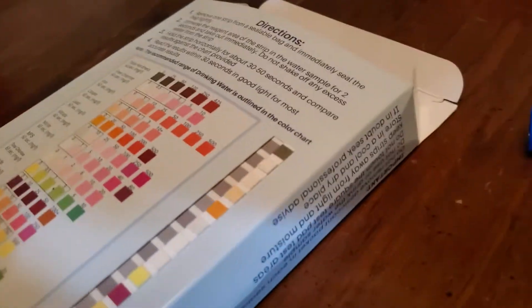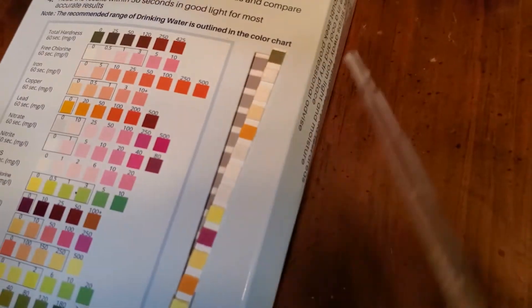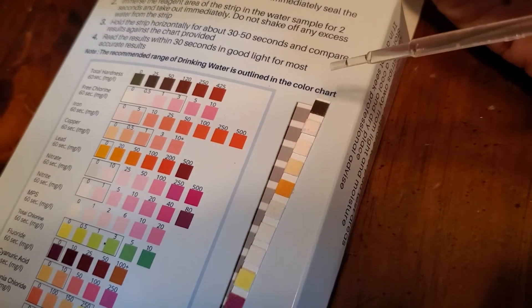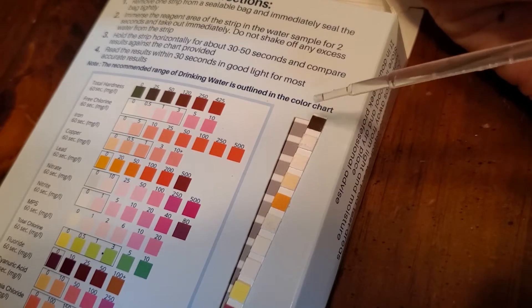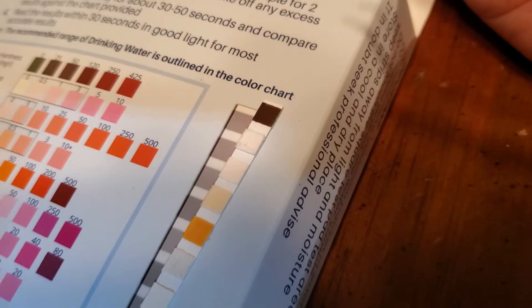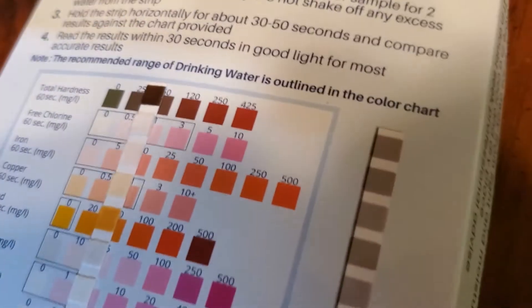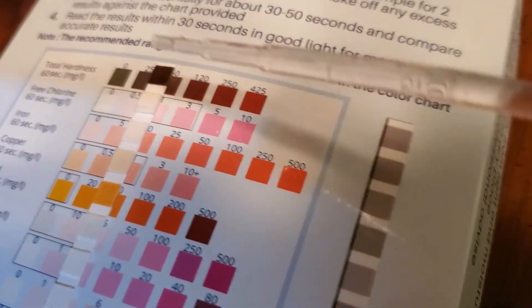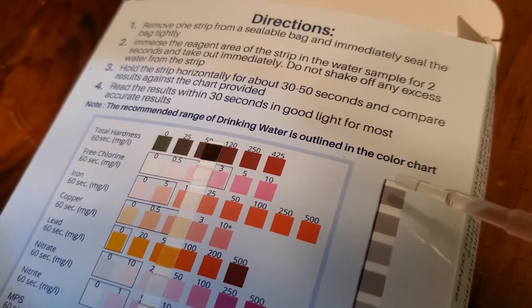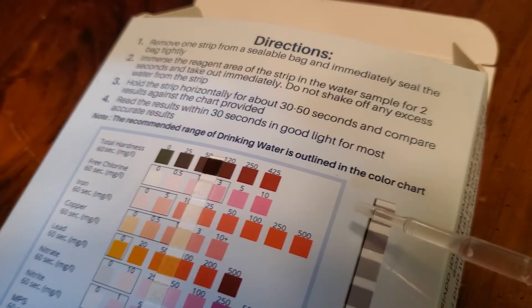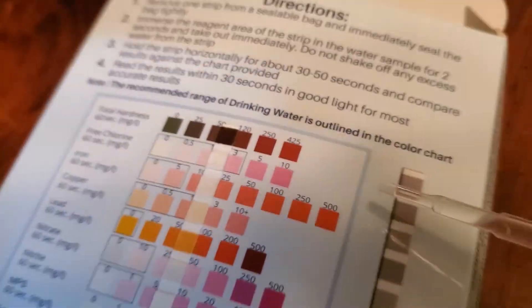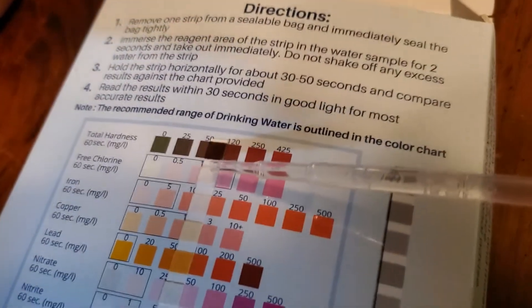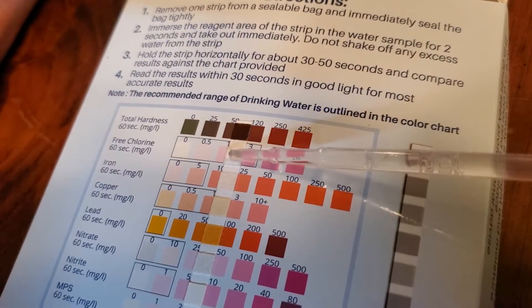First we will test for water hardness. Let's throw a drop or two on there, give it another drop, and then you slide it over the thing and try to match it up. It looks dark, probably right around in between these two. I think that's right. My camera messes up the color, but it does look closer to that. We do have hard water here, that is a known fact.